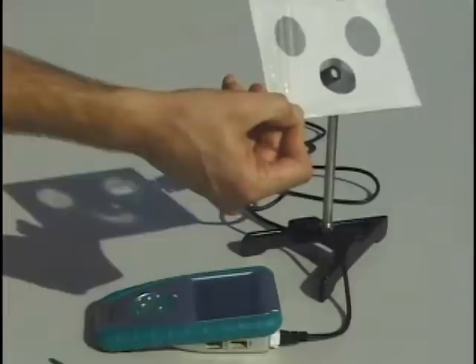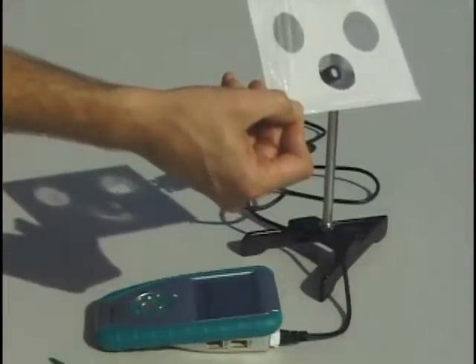In the actual lab, we go for 20 seconds on each sample, but here we go for more like 15 seconds.